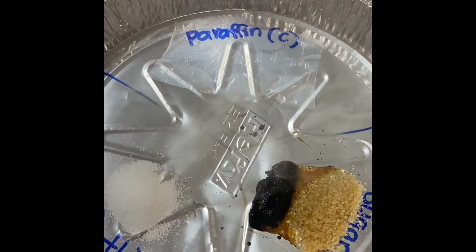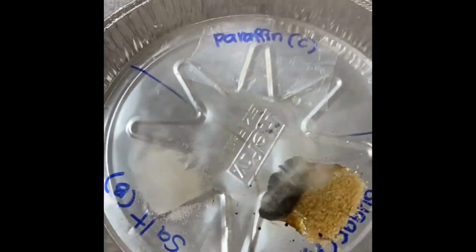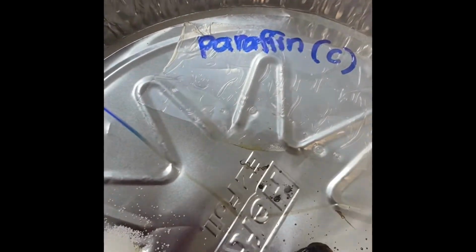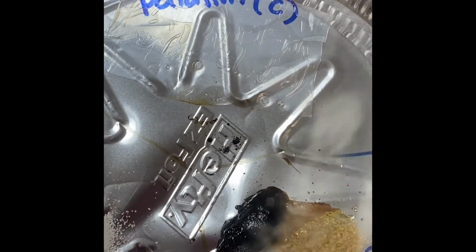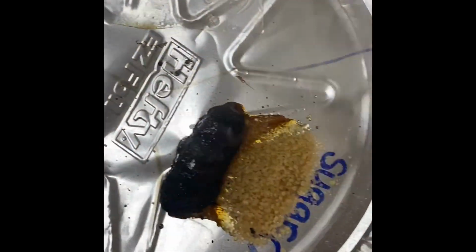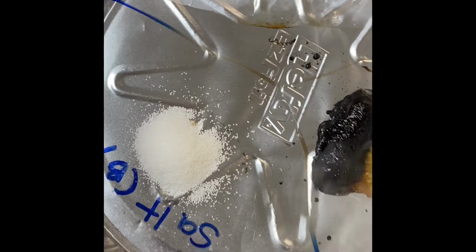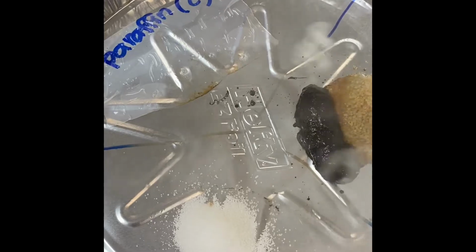All right, I'm back with this. Okay, a different view. Actually, it's better than what I had the first time, so you can see. The paraffin is actually all stuck to the pan. All right, the sugar is bubbling up. Got this nice little black substance bubbling up. And then there's the salt. I got a couple more minutes remaining before this is done.